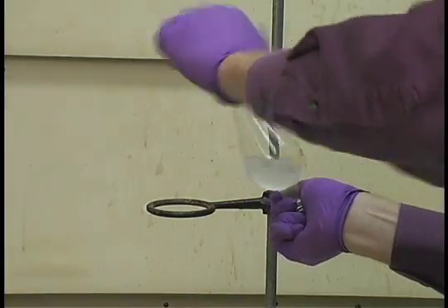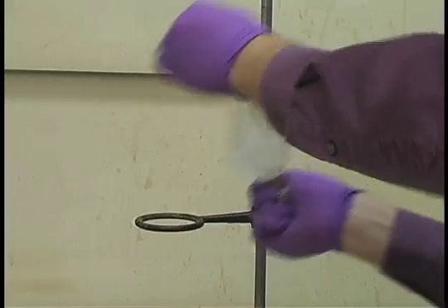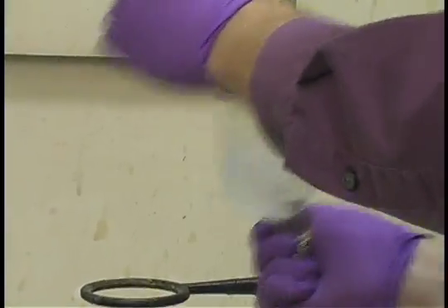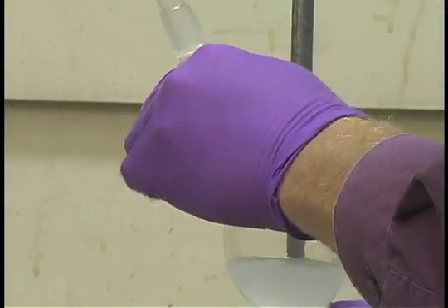Repeat this process for a total of about one minute, swirling for ten to fifteen seconds and venting to release any buildup of pressure.